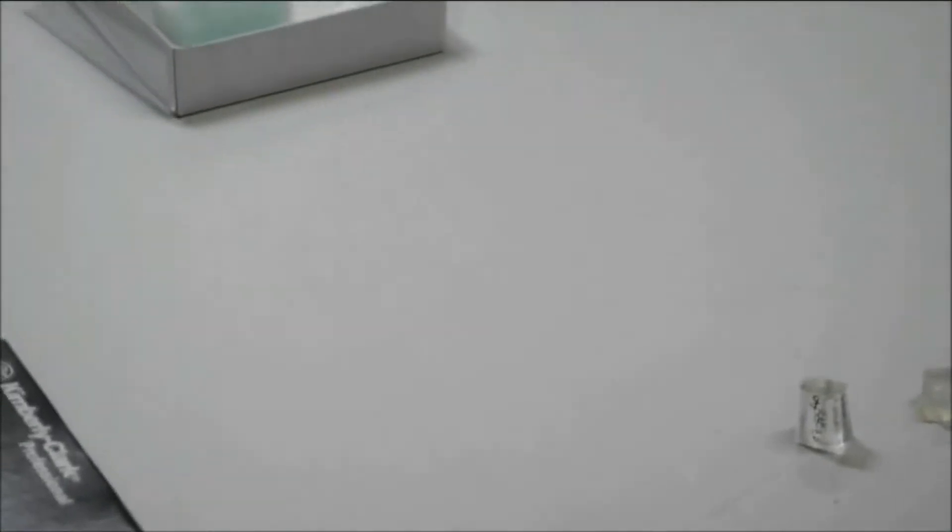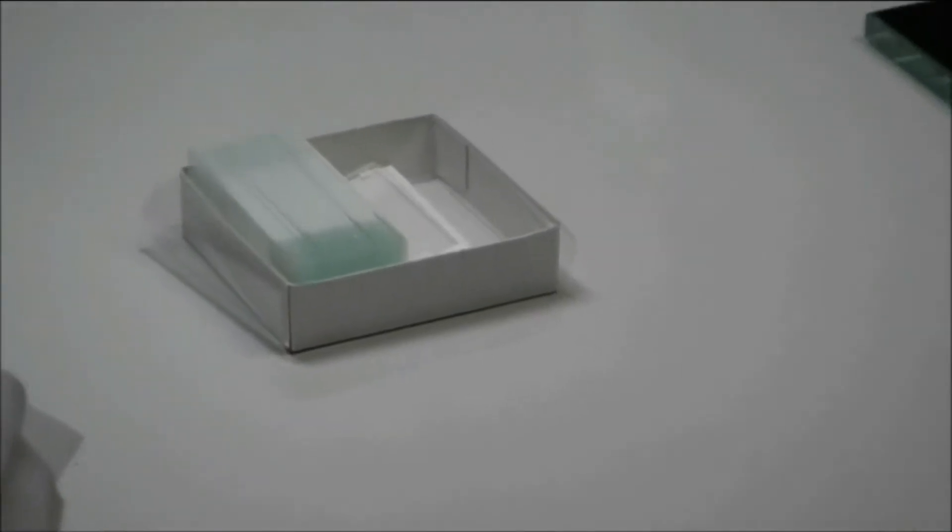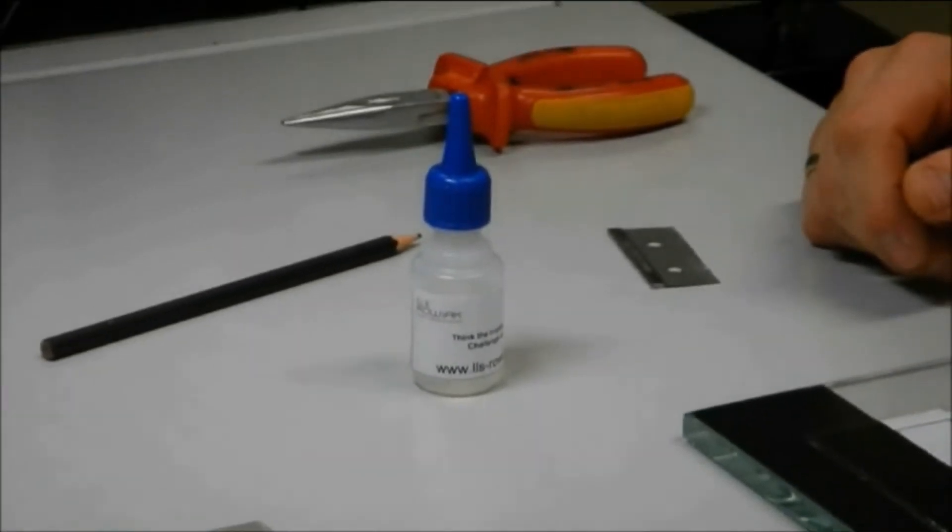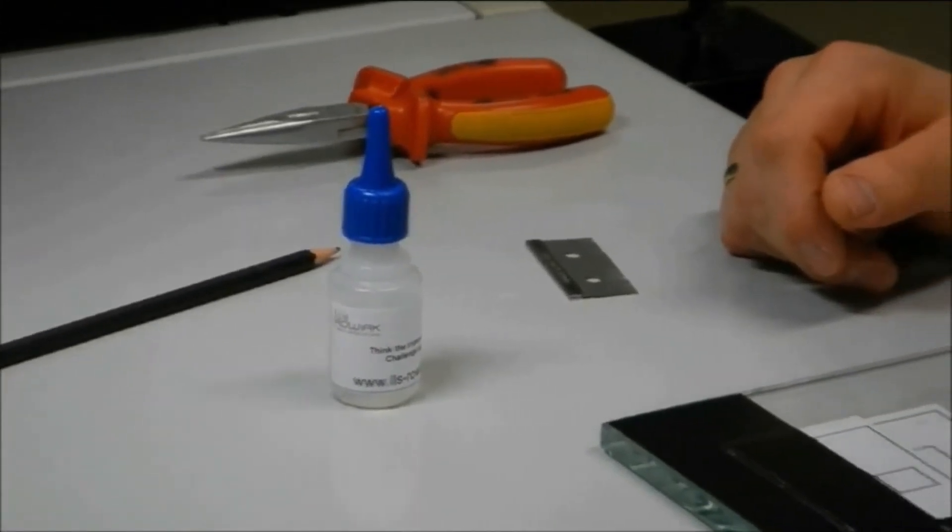For the preparation of the sample, we require a suitable microscope slide, a special fast action glue, and a pair of pliers for the separation of the block and the section after cutting.